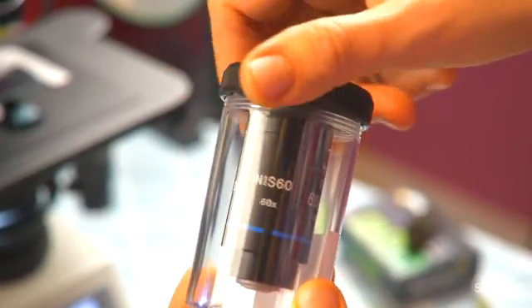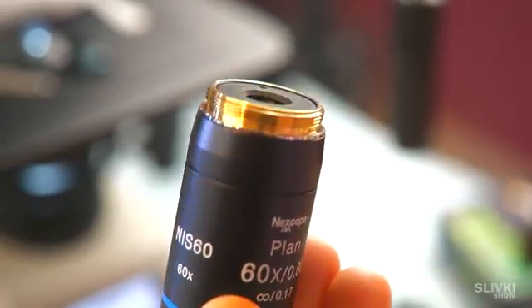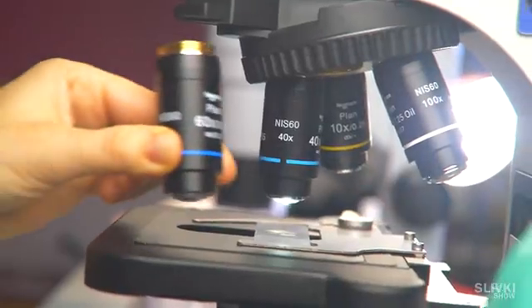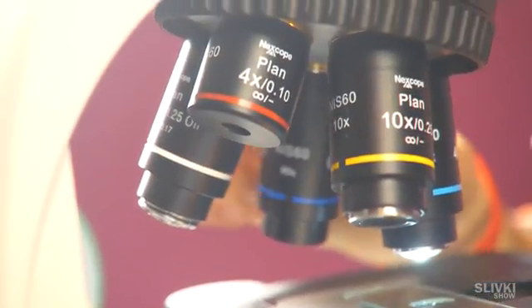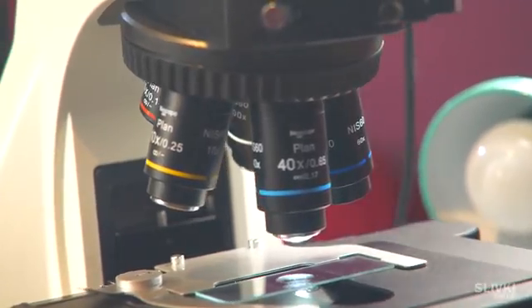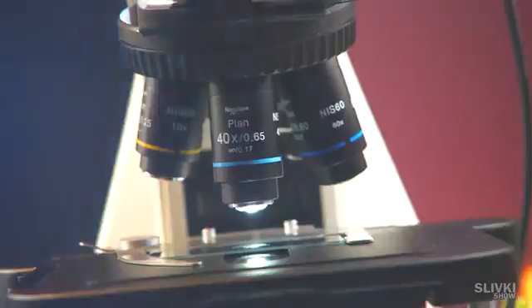By the way, we're not standing still and found an additional lens for our microscope, which will open even more opportunities for us.